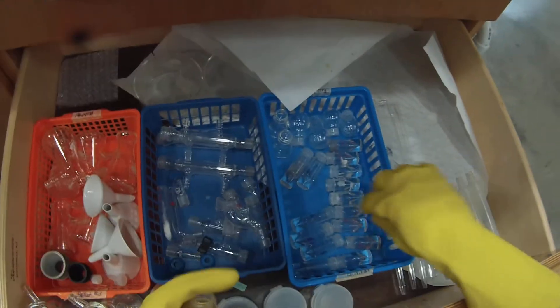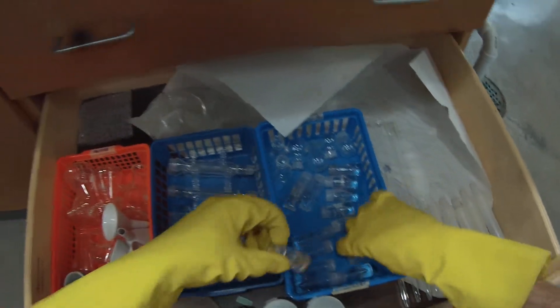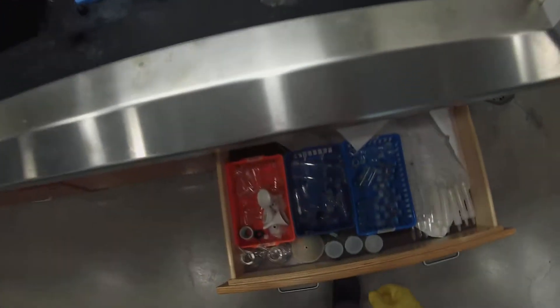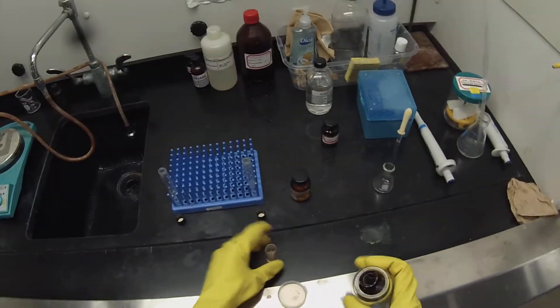So we're going to grab a nice clean three milliliter conical vial. That one looks a little dirty. I think that one's clean enough. And we need a septum cap for that.